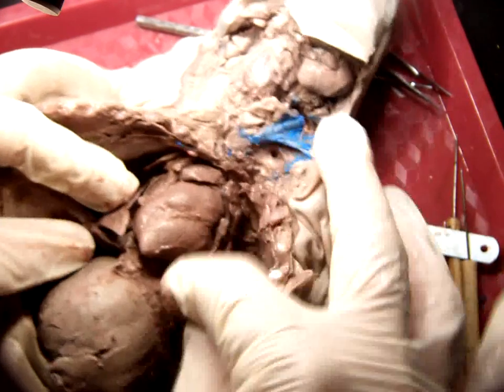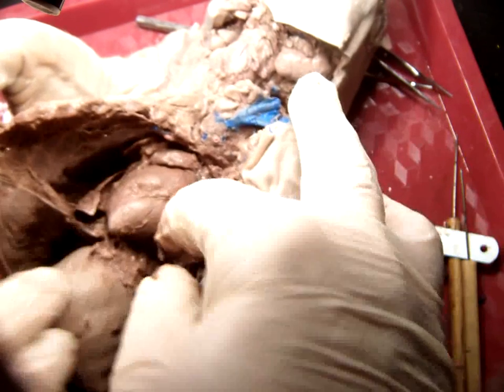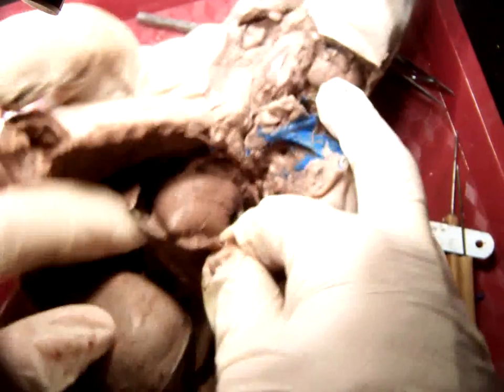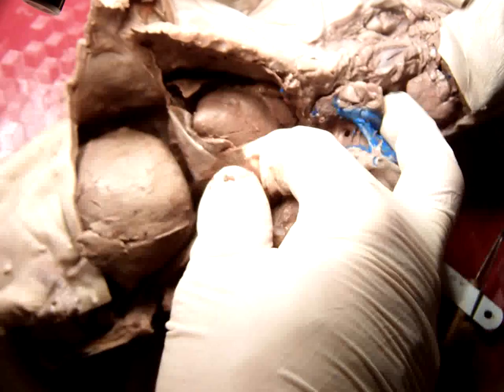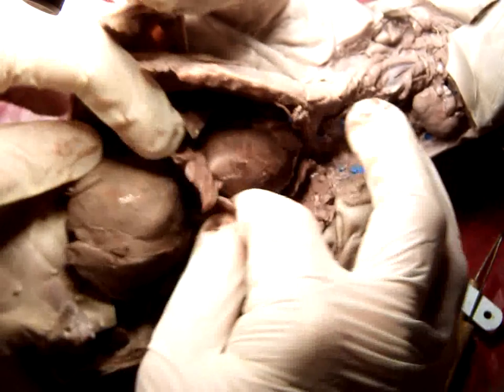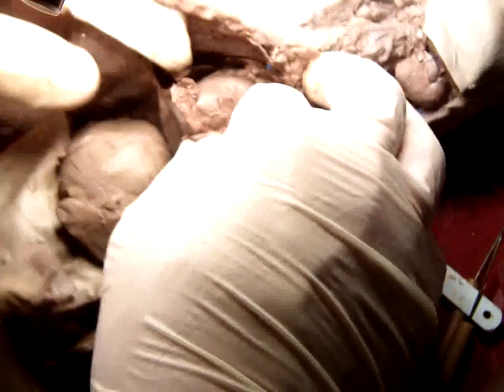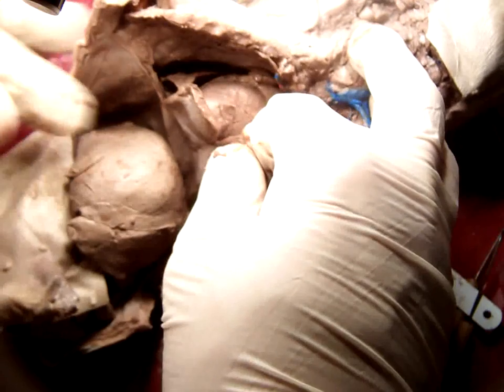Now right below that, what separates the thoracic or chest cavity from the abdominal cavity is this dome-shaped muscle right here that I'm lifting up. What's this muscle called? Diaphragm. Everybody take in a deep breath. Smell that delicious air. That pulls down. Now exhale. As you exhale, that diaphragm comes back up again to decrease the volume of the lungs. But that is the barrier. You can see it forms this perfect barrier from the thoracic to the abdominal cavity.